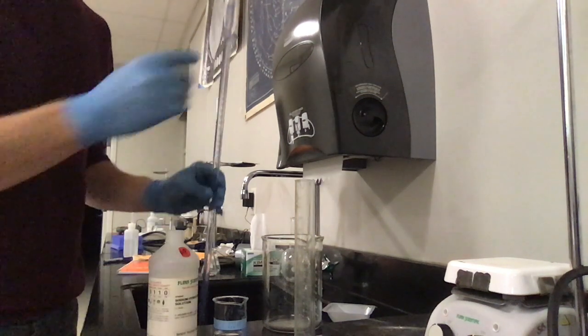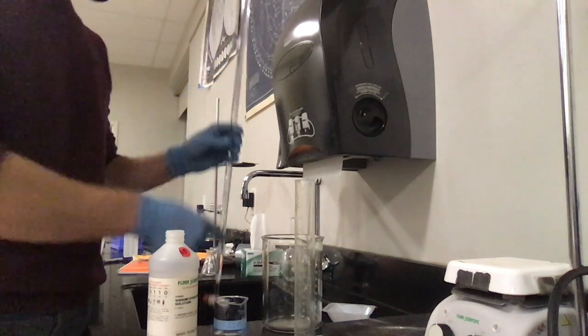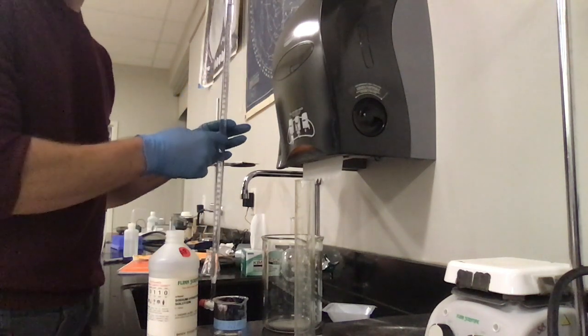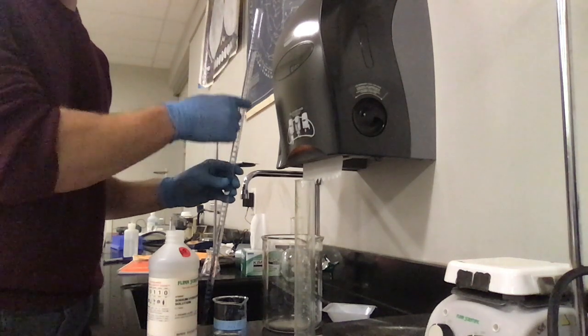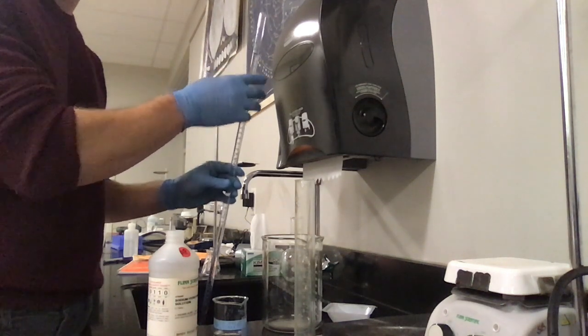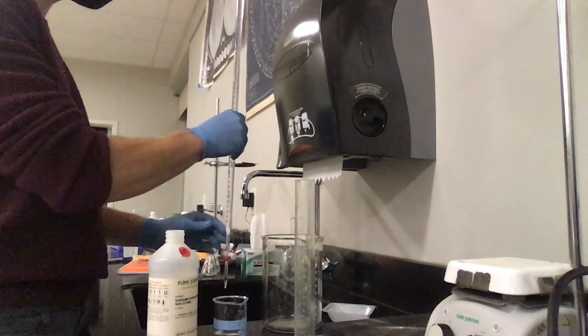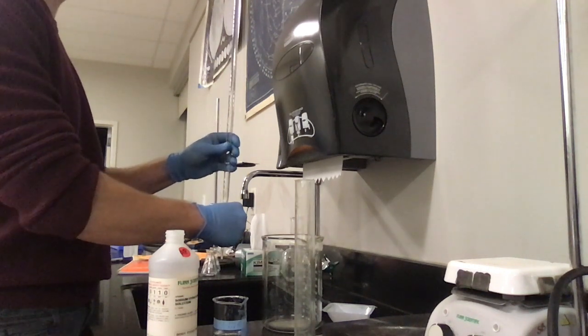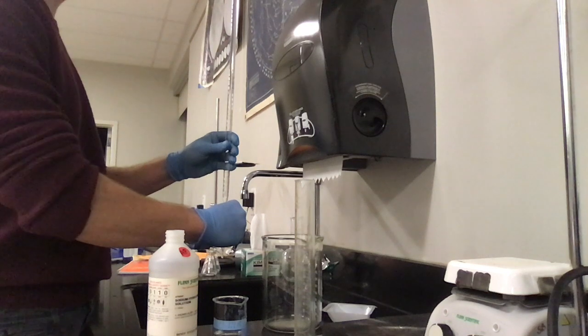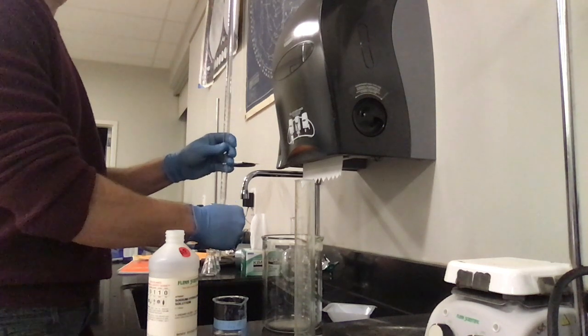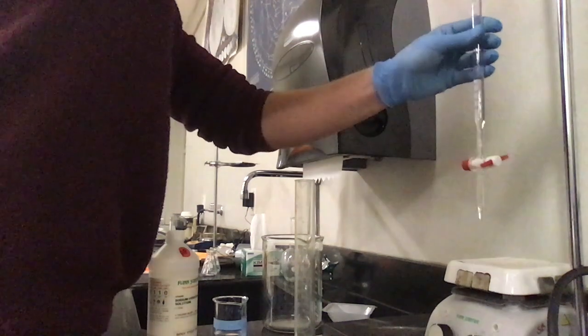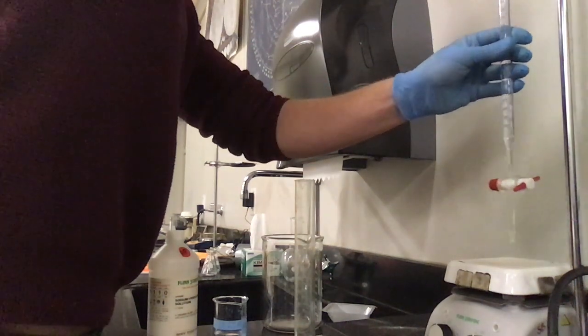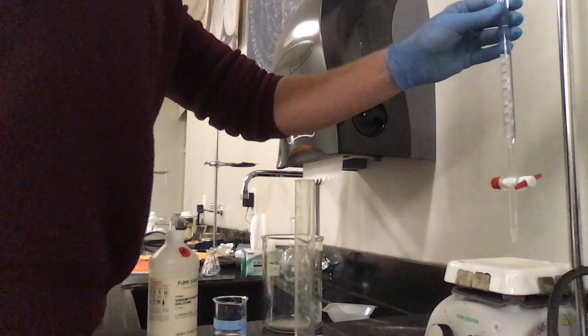So I've actually filled it up a little bit past my zero mark. Any other moment during that filling process would have been fine because I've got graduation, but because I filled it all the way up past where that last graduation is, I'm just going to empty it. I'm going to open my stopcock and I'm going to empty this down to that zero mark. Nice and slow. All right. I have exactly, it's now exactly at that zero mark.